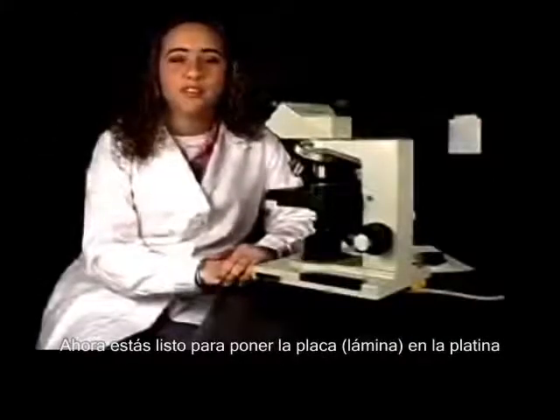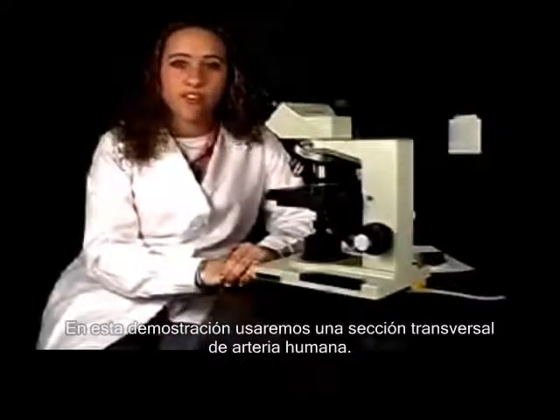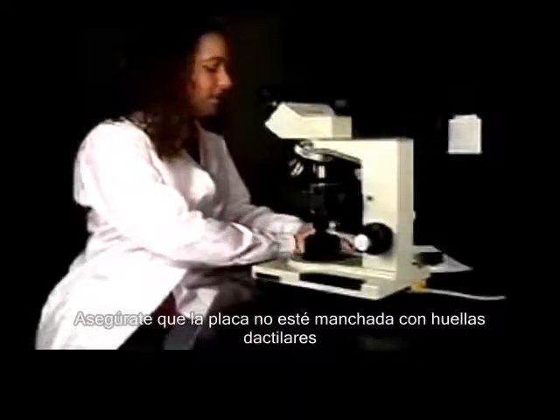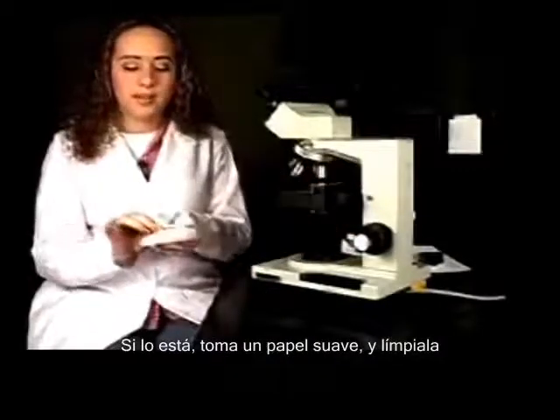Now we are ready to put the slide on the stage. For this demonstration, we're going to be using the cross-section of a human artery. Make sure that your slide is not full of fingerprints. If it is, you're going to take a Kim wipe and clean it off.